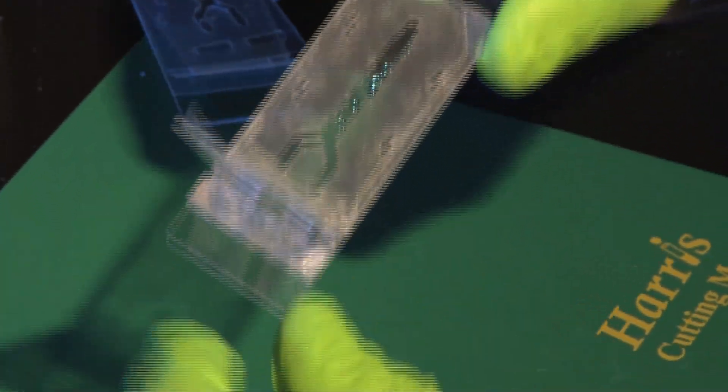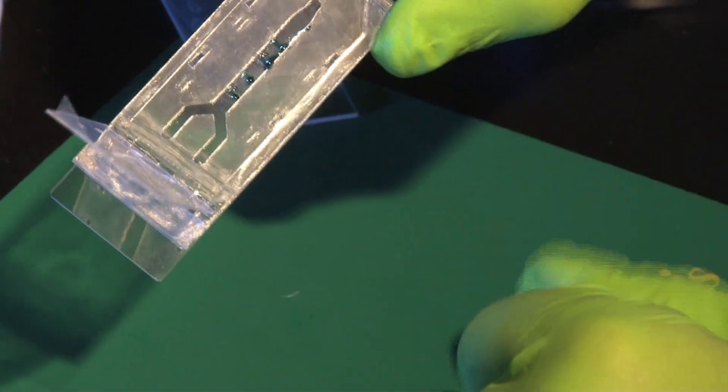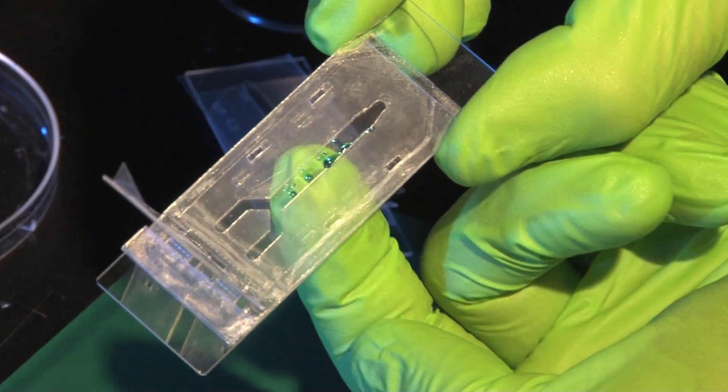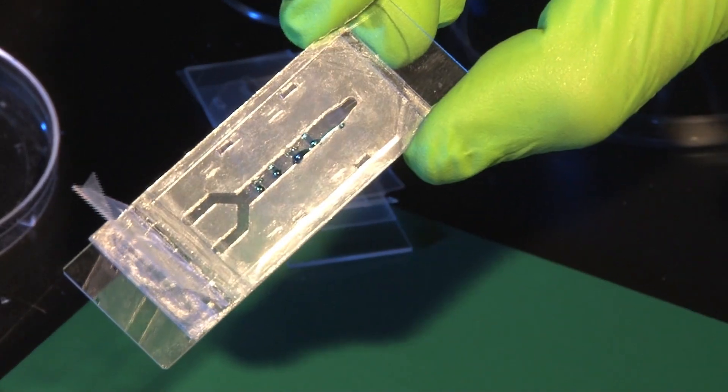So even if there are small droplets on the inlets it doesn't matter because we are going to close the chip, but what matters is that the liquid has gone through these little trenches, the buried channels.